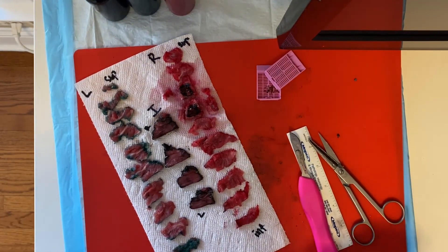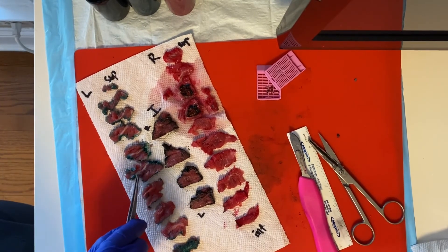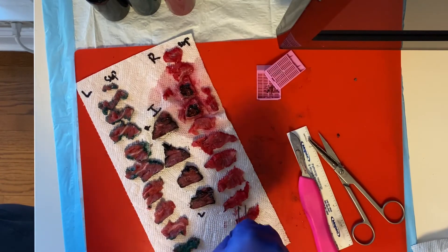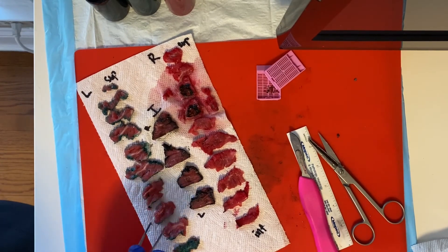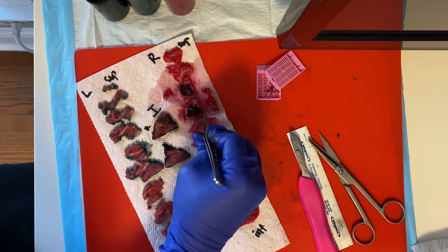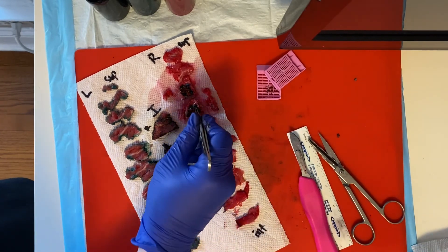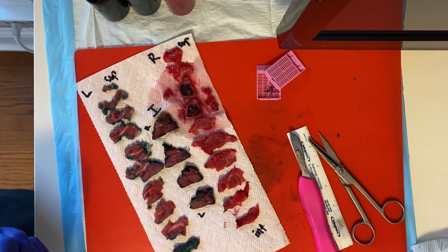We would submit our entire lesion capsule, and in this case our entire lesion since it's small enough. Then we describe our uninvolved thyroid parenchyma — I would call it red-tan with intermixed pale-tan fibrous bands. We're going to submit representatives from the right lobe superior and inferior, left lobe superior and inferior, and one representative section from our isthmus. For follicular lesions, the only way to differentiate follicular adenoma from carcinoma is to see if there is any extracapsular invasion out of the lesion capsule or any vascular invasion. So we want to see the entire interface of our lesion with the adjacent thyroid parenchyma.